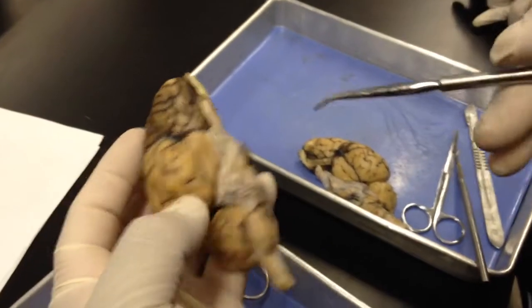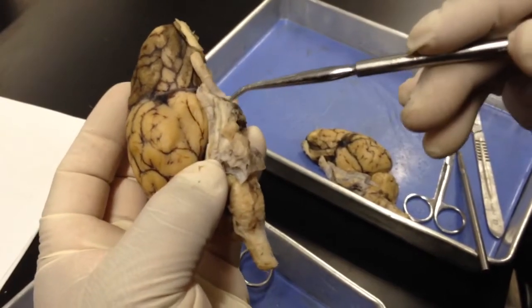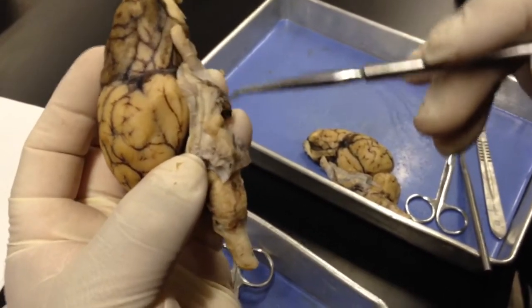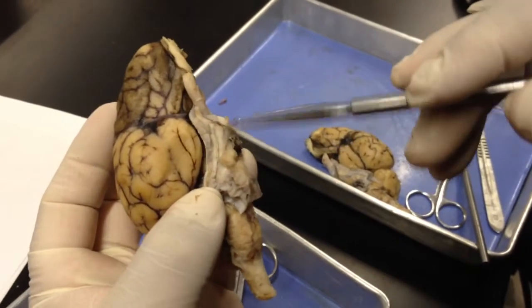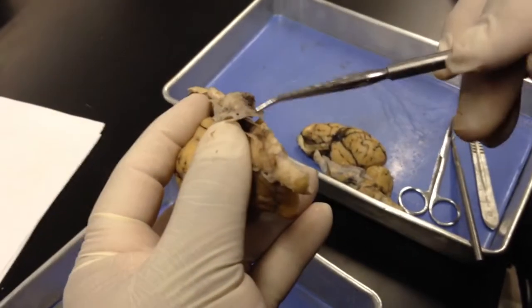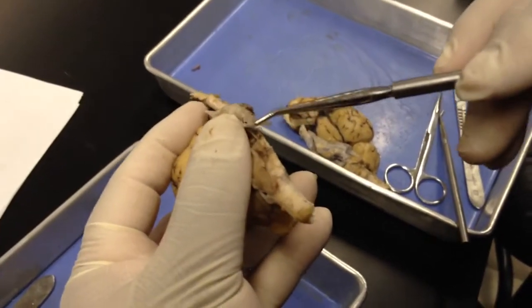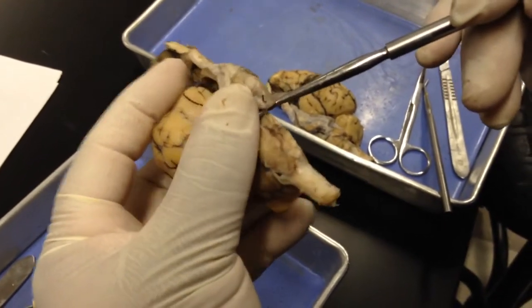The next highly visible nerve will be the trigeminal. This is a fairly large nerve with 3 branches here. 1, 2, 3 branches. So that's our trigeminal nerve. Inferior to, or deep to the dura mater here, you have your abducens coming off of the pons.